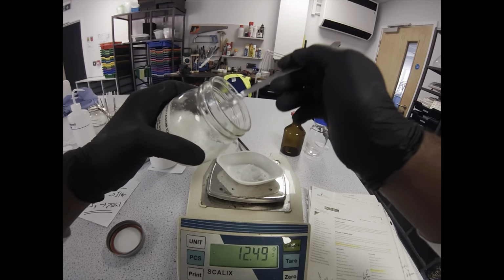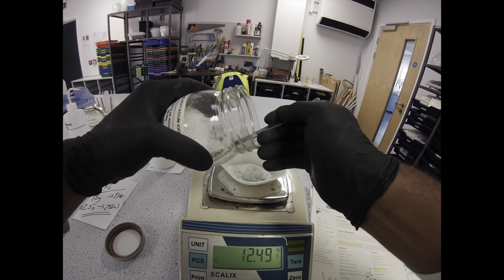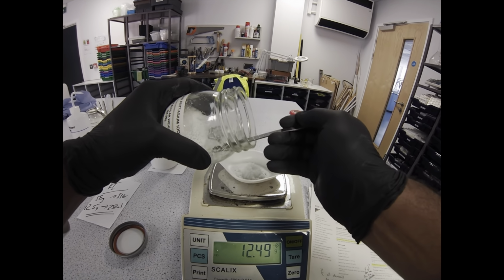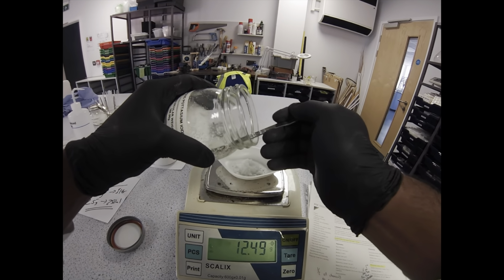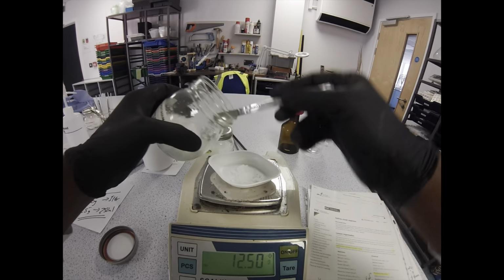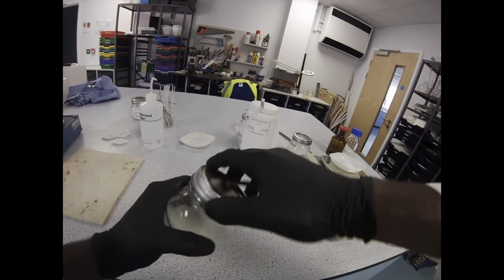Lots of really great uses for KI, lots of really cool displacement reactions you can do with halogens, with iodine as the indicator for that reaction. Obviously elephant's toothpaste, another classic, using potassium iodide as a catalyst for decomposition of hydrogen peroxide.